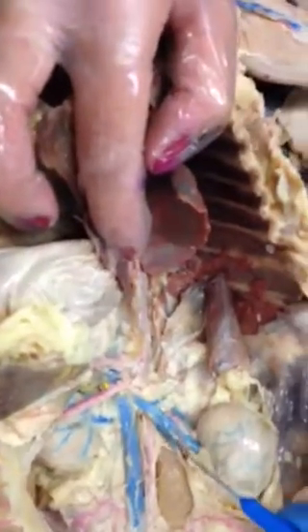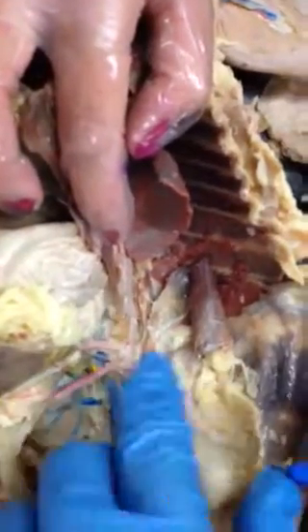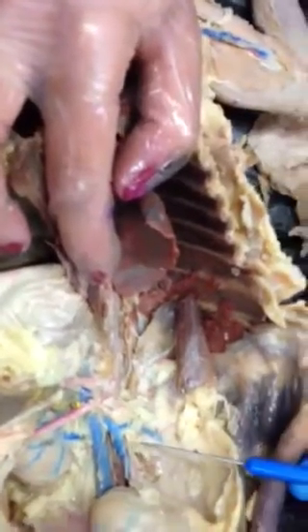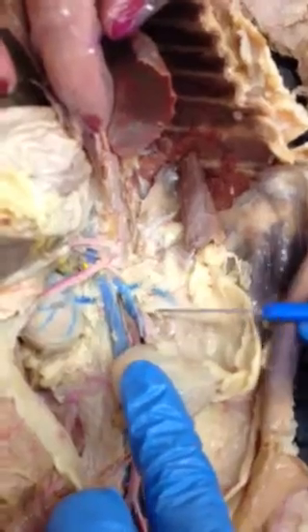We'll continue down. The next thing that's going to split off, well, actually, while we're up here, I'll talk about this too. These are your kidneys. So what's connecting to your kidney are always going to be called renal whatever.